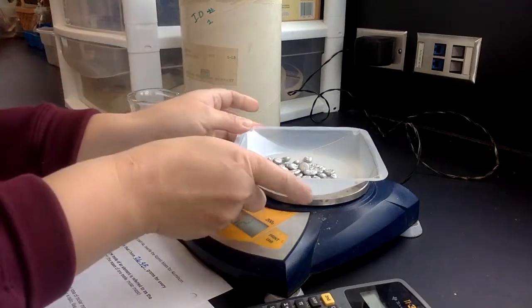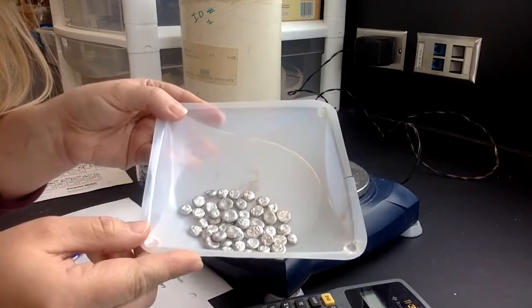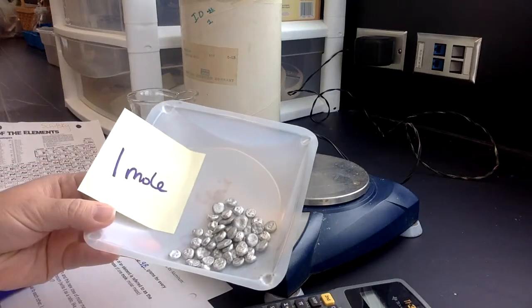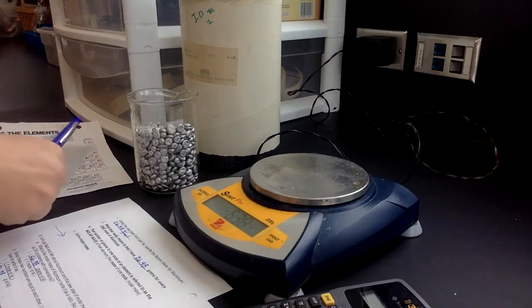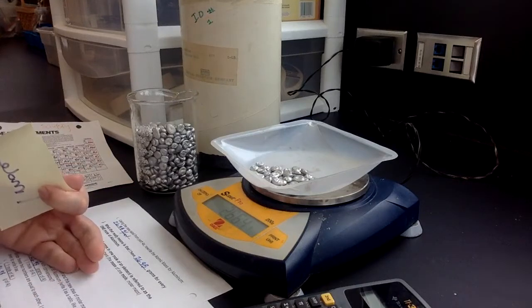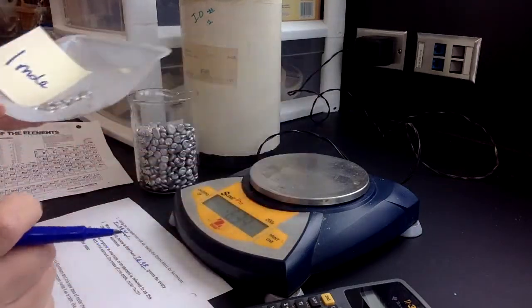So this is 26.62. This gives you a visual now of what 1 mole looks like. Well, this is what 1 mole of aluminum looks like. And I'm going to label that 1 mole. So 1 mole looks like this. We've got our reference piece here. Now, again, that exact mass was 26 point, I don't remember what it was. I've got to look here. Put that back on there. 26.64 technically is what I have. That's approximately the 1 mole. All right, so that's my sample size for 1 mole.